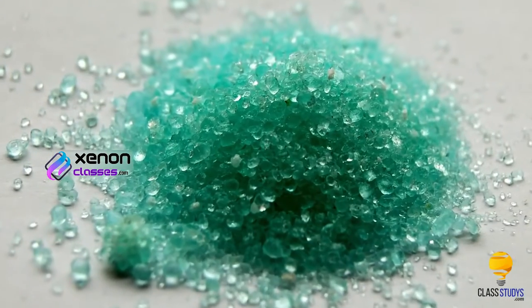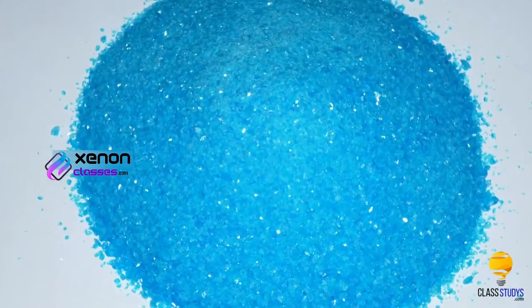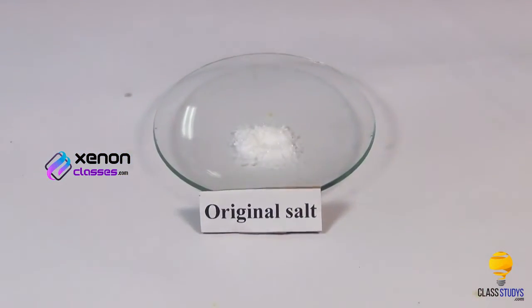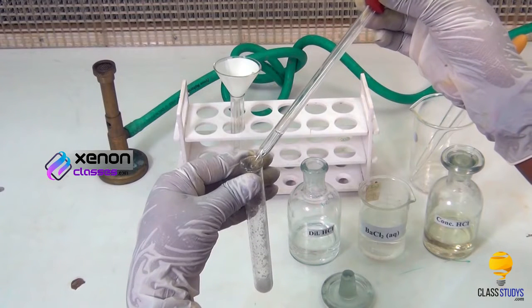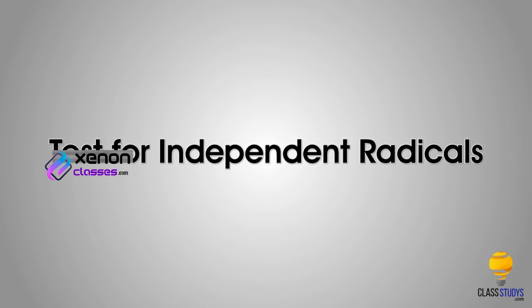Very well-known colored salts of sulphate are green vitriol and blue vitriol. Our aim here is to test the presence of sulphate ion in a given salt. Let's look at the preliminary test of sulphate. Test for independent radicals.